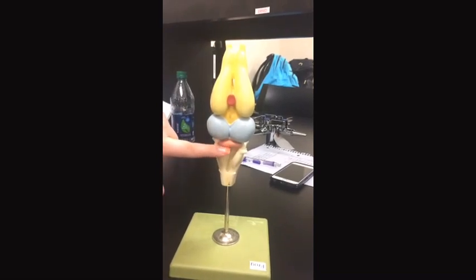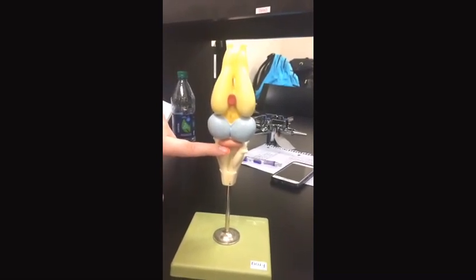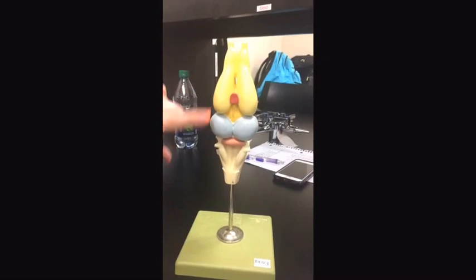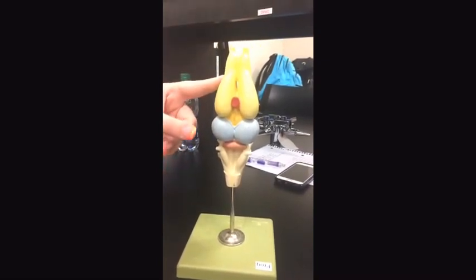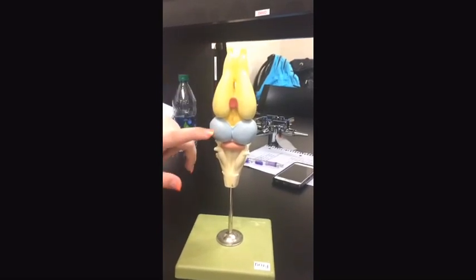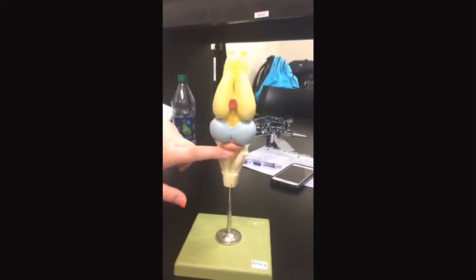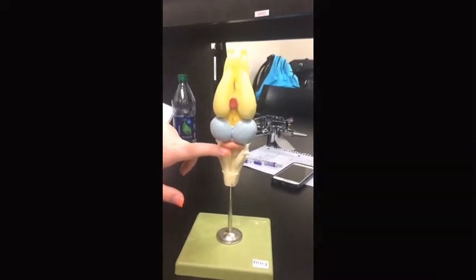As you can see, the hindbrain isn't as well developed as the midbrain or the forebrain. The forebrain is more developed than the midbrain, so the olfactory senses and complex behavior are more dominant than sight. But sight is more prominent than the involuntary and motor activities.